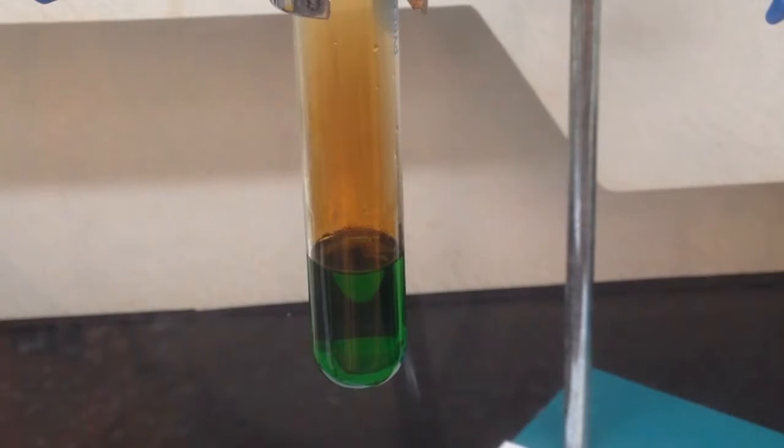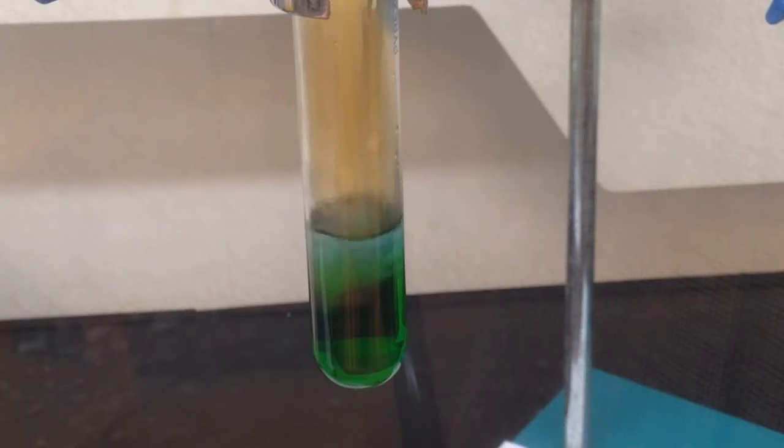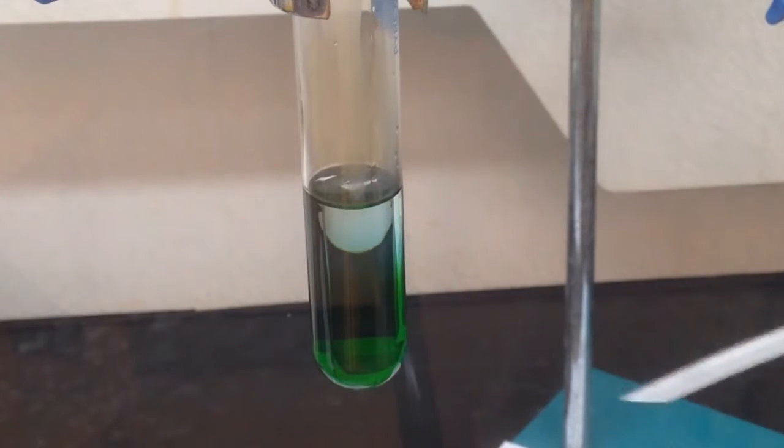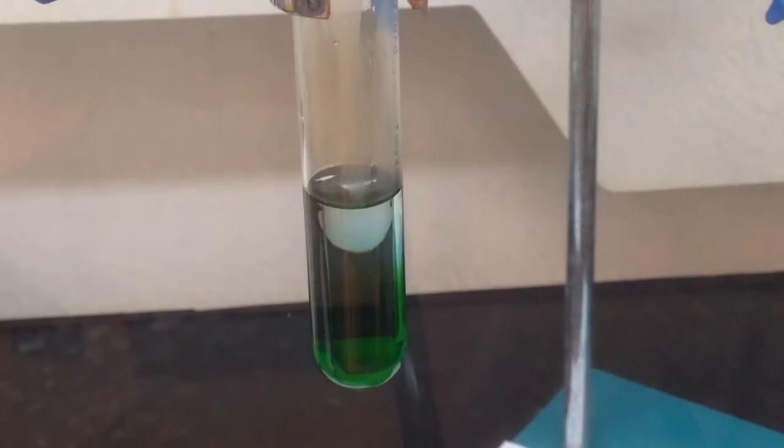Simply, we can add water into it. Firstly, adding water is to dissolve the nitrogen dioxide. We can remove the nitrogen dioxide by adding a little more water, displacing it, because nitrogen dioxide itself is highly dense. So we add water, and we're pushing the nitrogen dioxide gas away. You notice after adding some water, the brown gas disappeared.